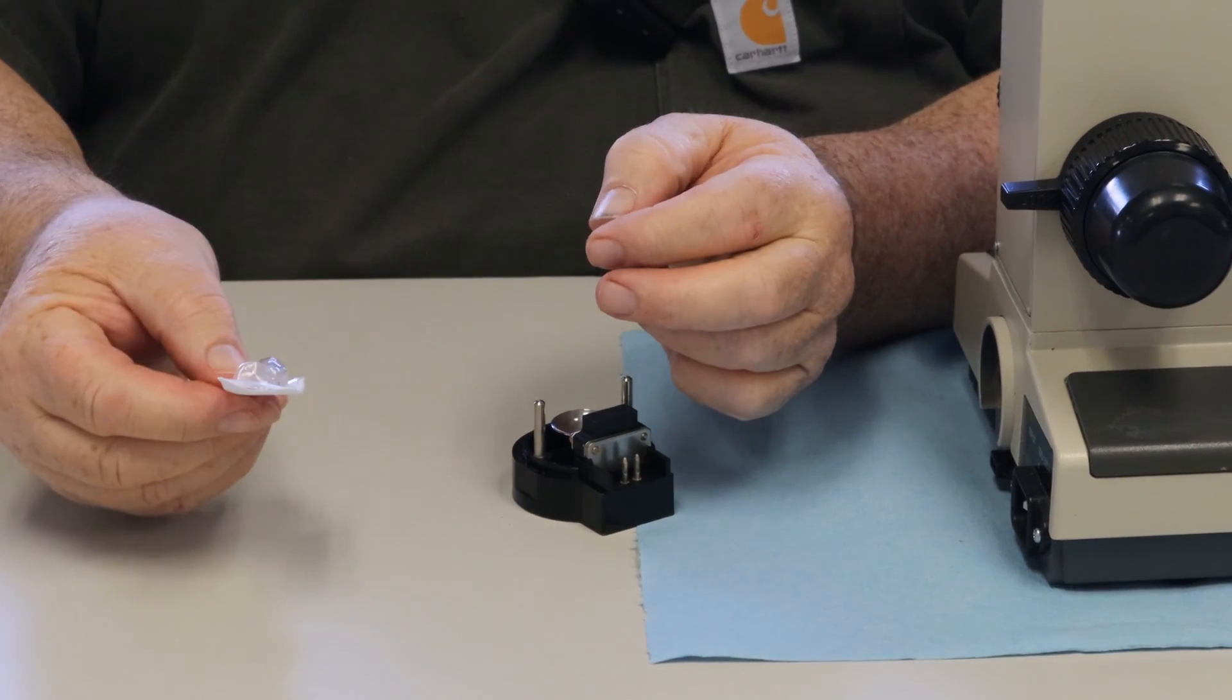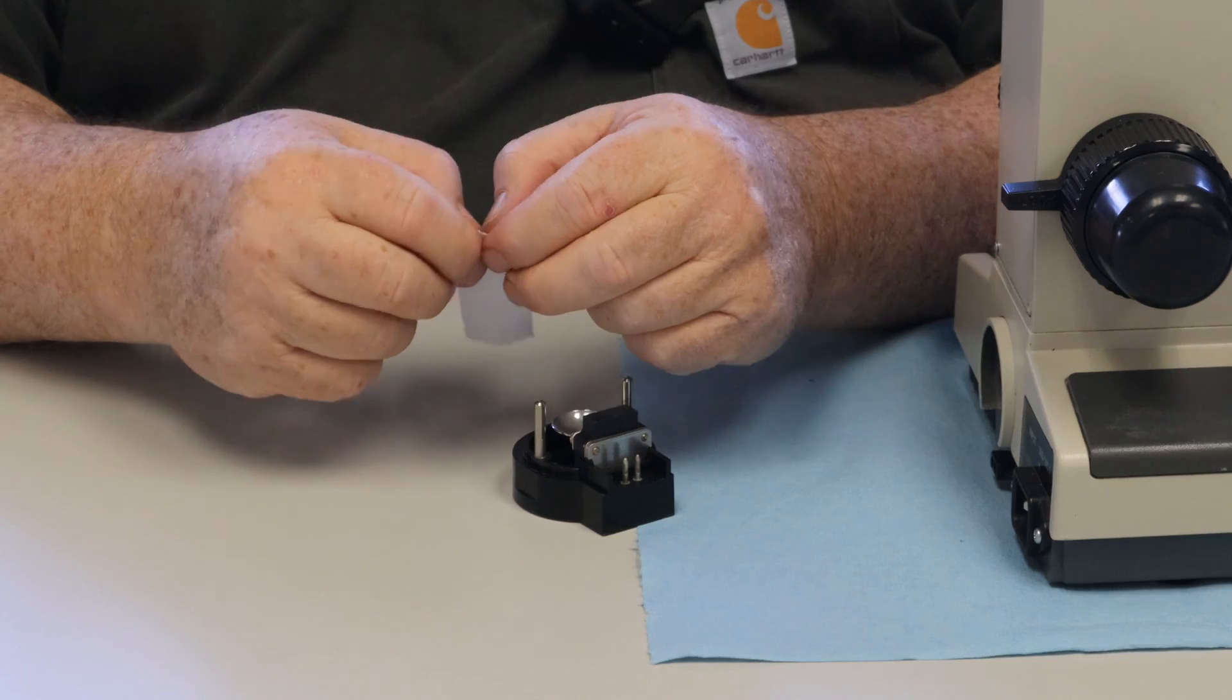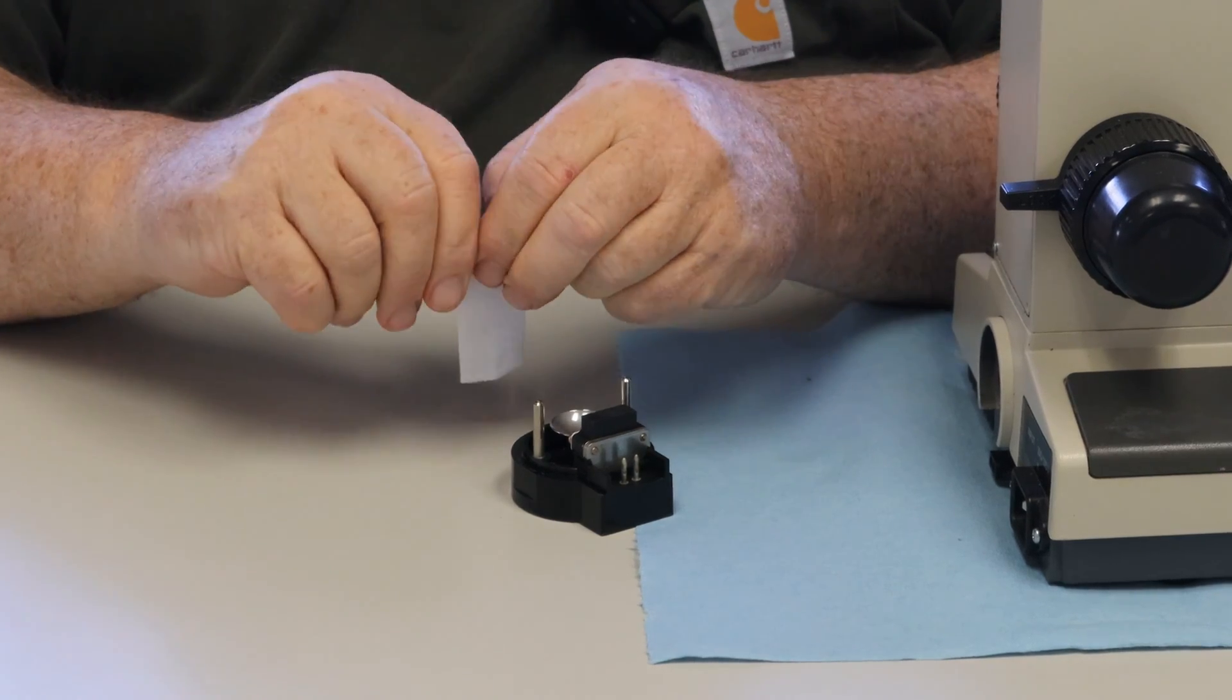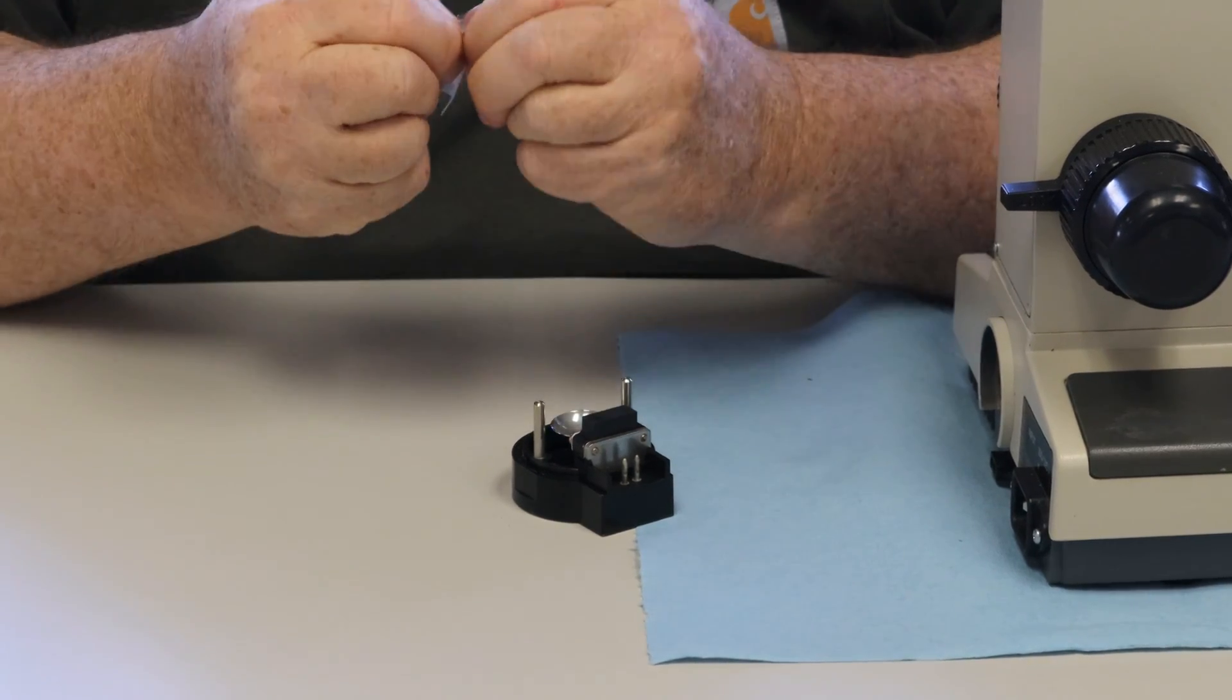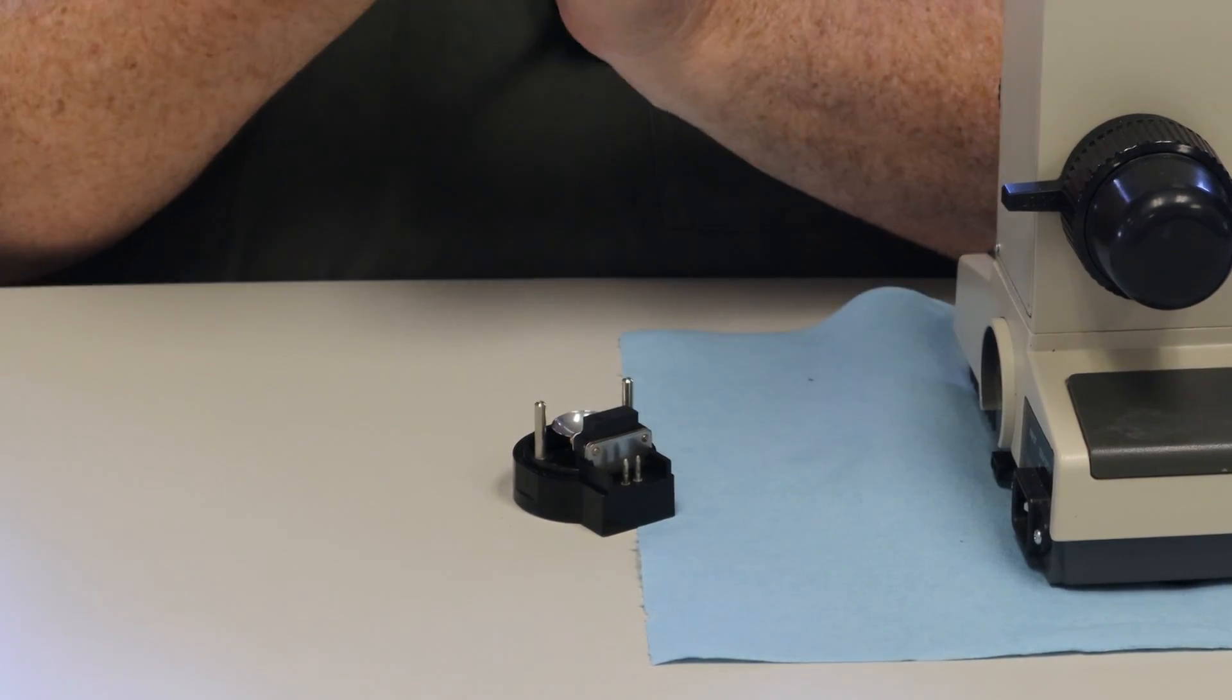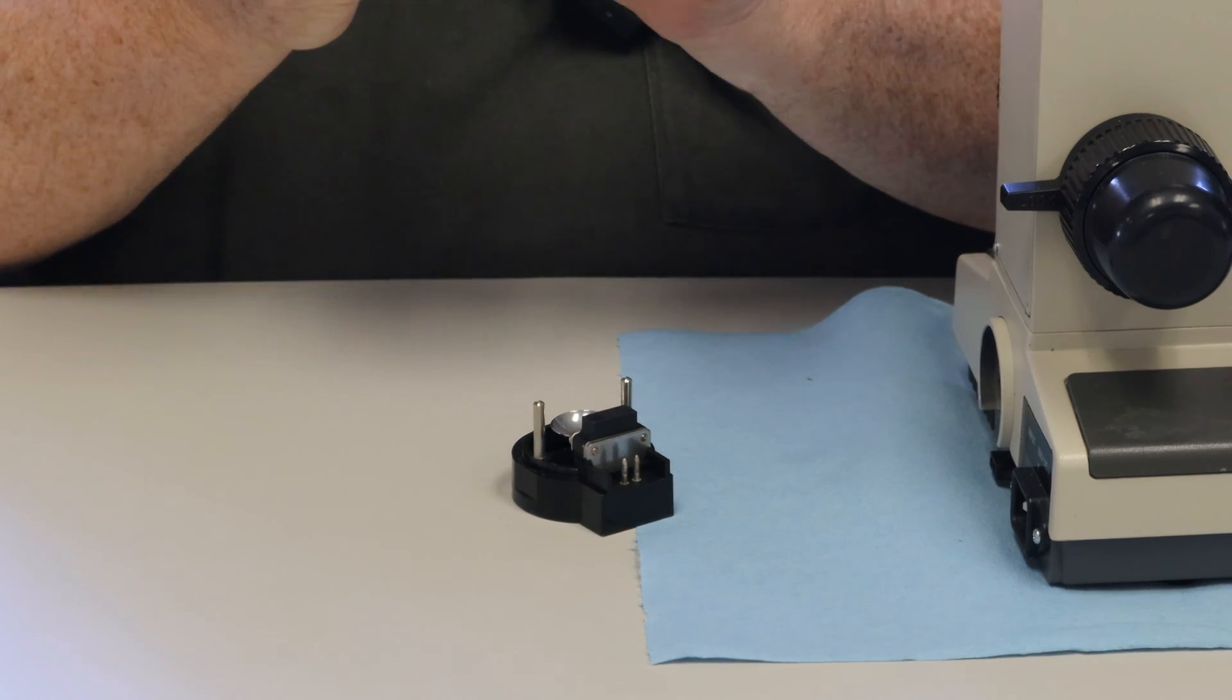They come in pre-sealed plastic bags, so it's very simple to either cut or tear the plastic away.